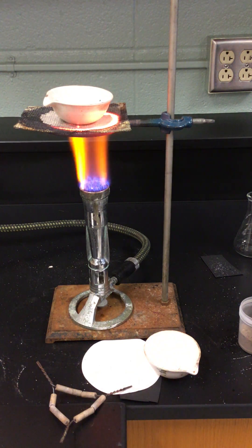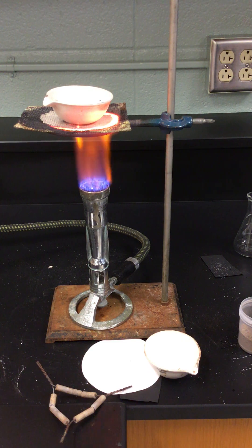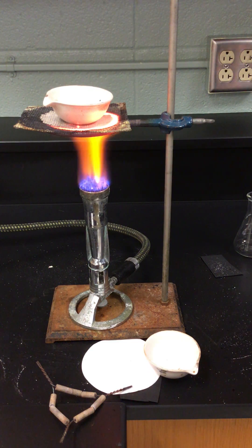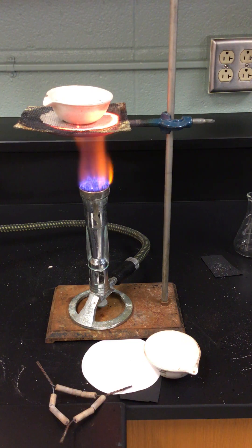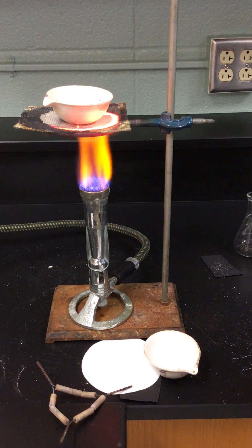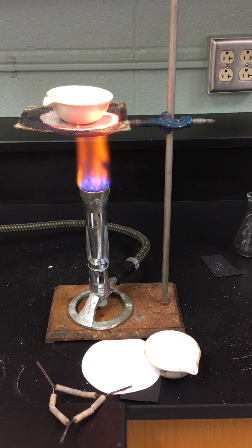One thing that we'll notice, and I'm sure you can hear this, this is going to start to sputter and sputter and sputter. If we look at the counter we'll see that our counter will start getting a little bit of white stuff on there. Now I don't know if you can see it spattering. I really don't want to hold my iPad too close to it right now because it's spattering so I'm not gonna give you a better look.